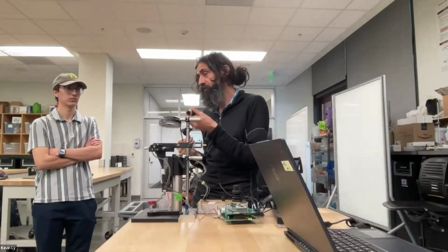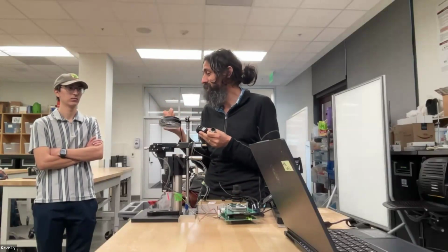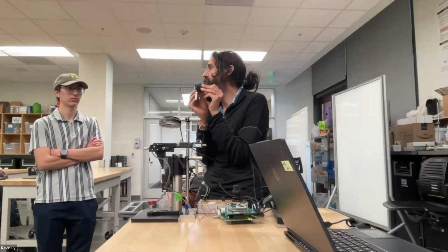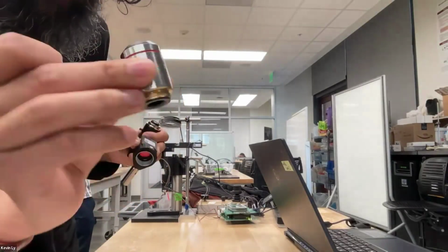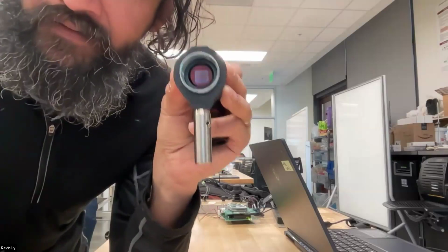What I mean by a telescope is just something that takes an image that's coming in with a certain size, but it will form a tiny image on this sensor, and I'm not using all my sensor. That would be wasted. So does that make sense? An image that might be coming out of this objective on the back focal side is not the same size as the sensor.